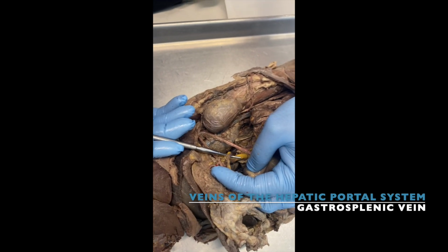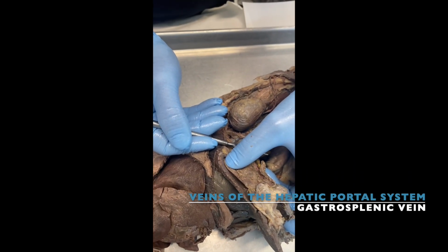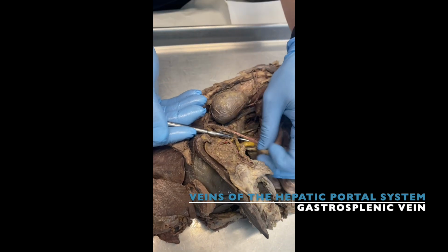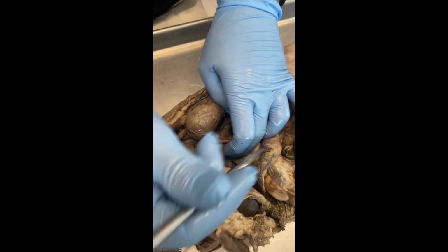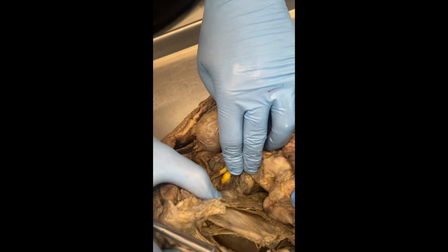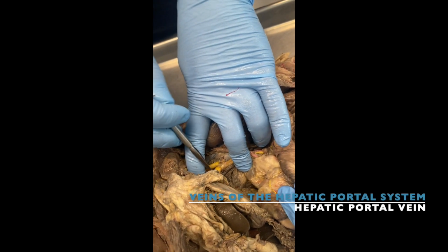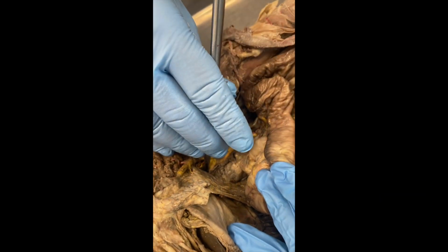If it's coming from the spleen and the gastric region, so that's gastrosplenic vein. Okay? This is gastrosplenic vein that combines with superior mesenteric and becomes the big one right there. That's the hepatic portal vein right there. Okay? That goes all the way back to your liver as well.